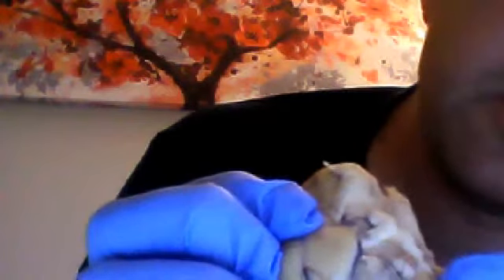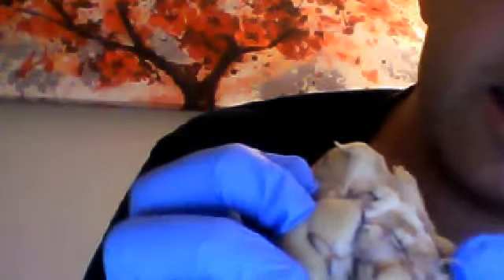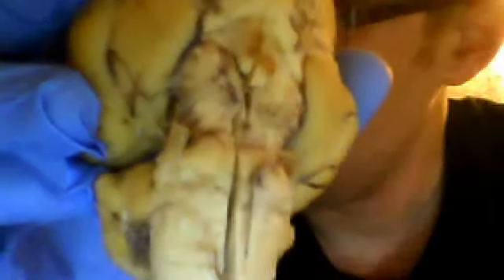The cerebral peduncle is located right, well, if we were to have the brain at its regular lie, it would be just posterior to the area of the optic nerve and optic chiasm. As you can see right there, pointing it out, that's the structure that we're looking at. Okay? And in addition to that, we have an area, let's get this in focus.